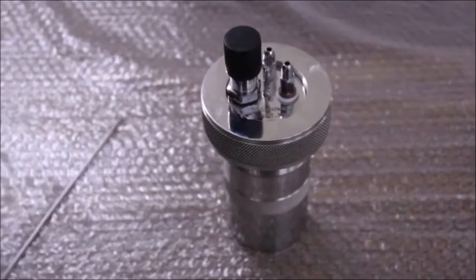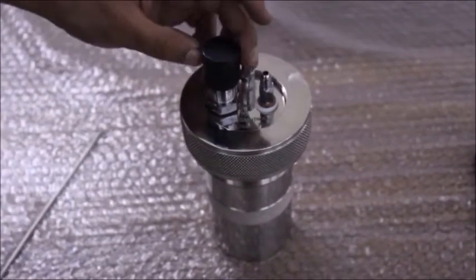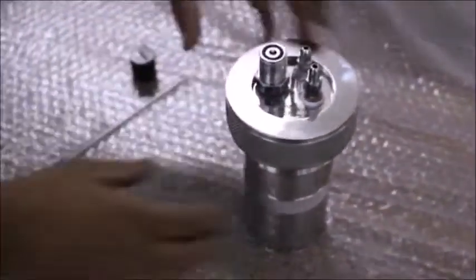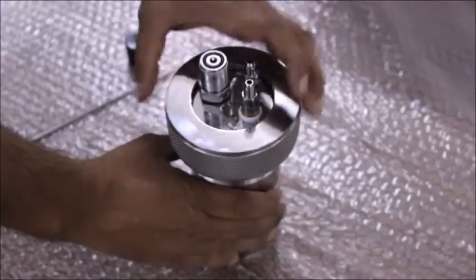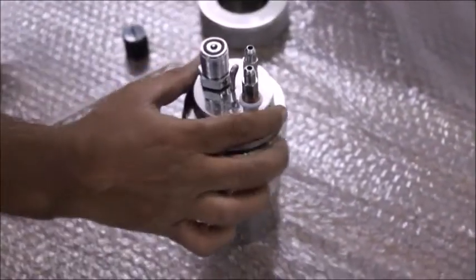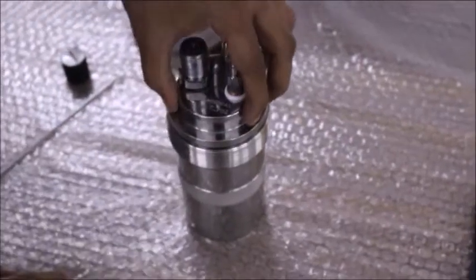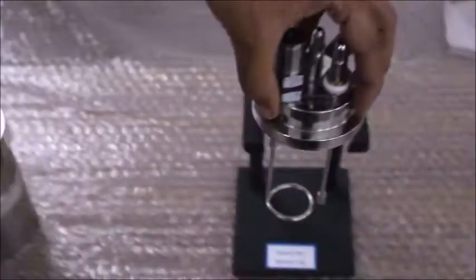This device consists of a bomb body, which is a cylindrical part of the bomb, the bomb ring which we are just removing, and the bomb lid which we will remove and place on the bomb stand.